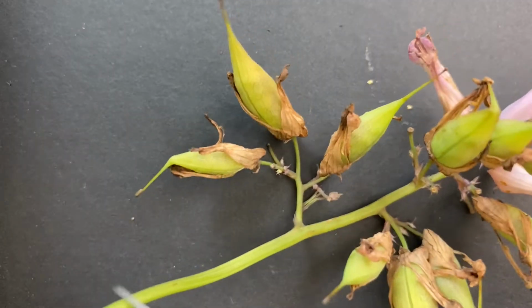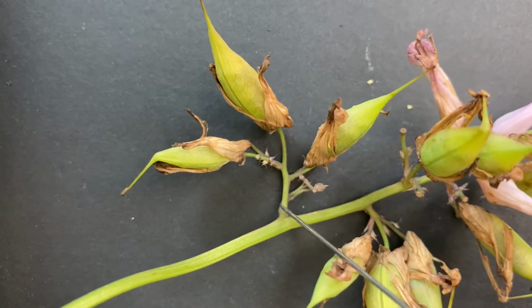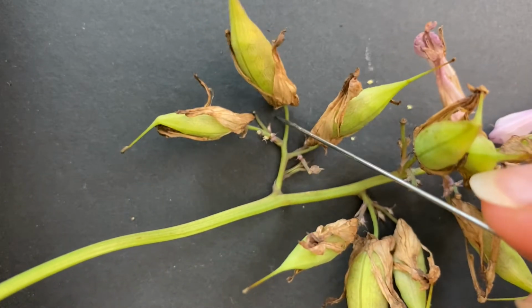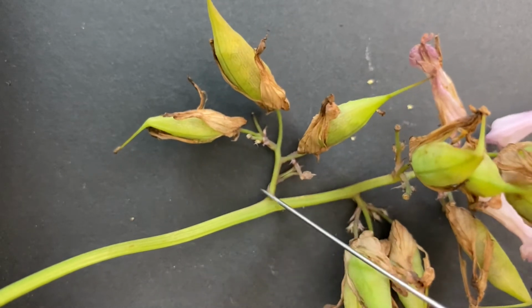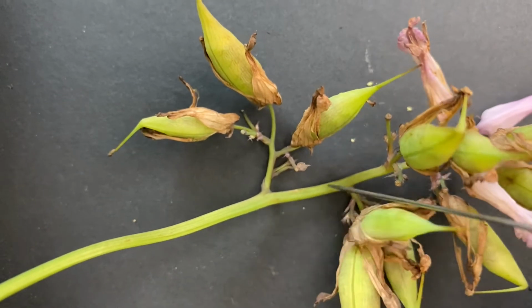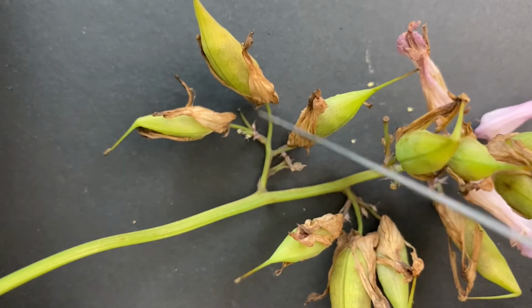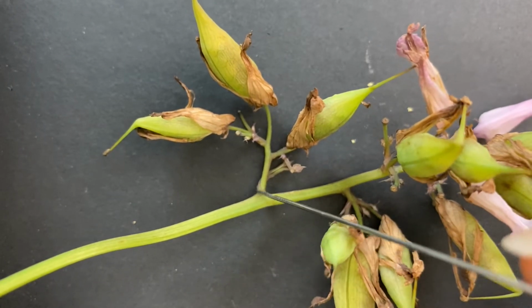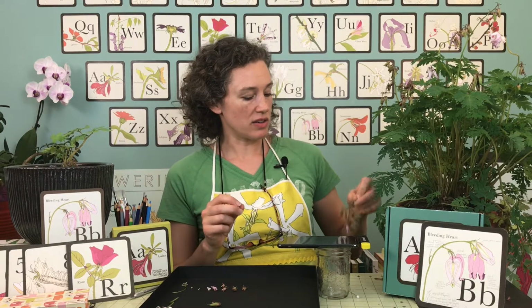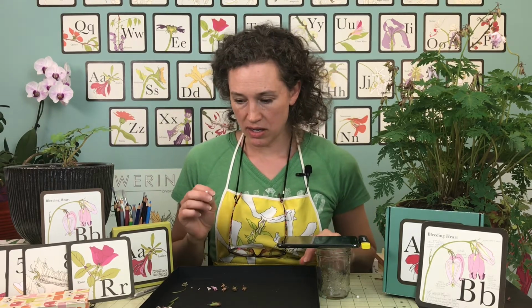So panicle is when it has this nice long piece and then it has a branch with several flowers on that one branch. If it were raceme, what would have happened is that there would only be one flower on each. That's the difference between raceme, which is what the Lamprocapnos spectabilis, the other bleeding heart that we did, had. It just had one central peduncle and then a single pedicel with a single flower, raceme. But this one is the panicle because it has a branch and multiple off of the main stem. All right, that's another way that the Asian and American bleeding hearts are different.